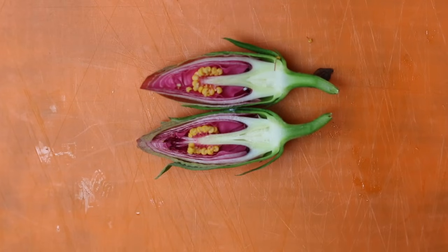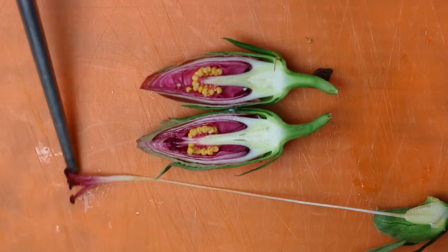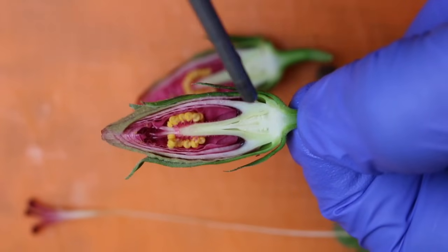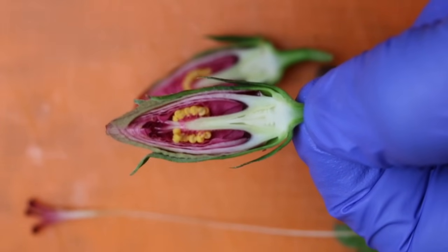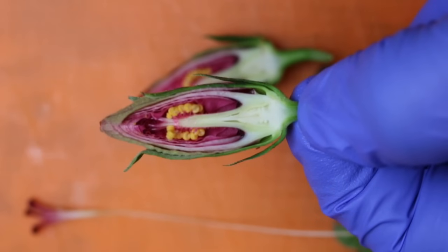Not as long as the flower would be once it fully develops, but we can see all of the parts there. Here is the stigma, attached to the ovary via the style — that long part — so that is how long the fully developed flower would be versus the bud. I've turned the light down so we can see the ovules better inside of there. They are not fully developed because this flower is not ready to bloom just quite yet, but we can see they are in there starting to develop, and we can see all of the other parts in there as well.